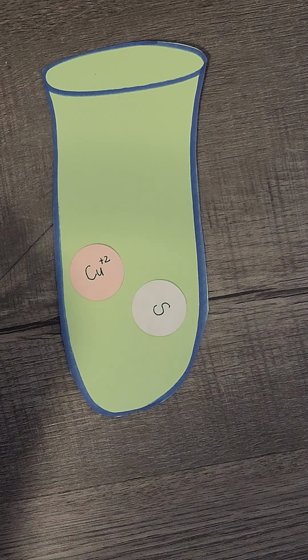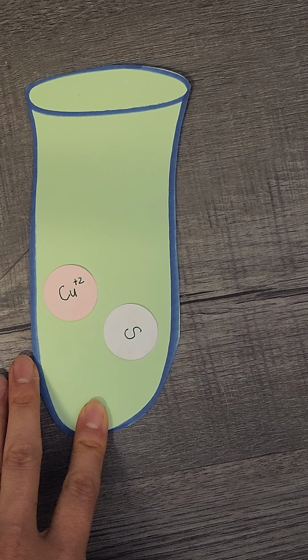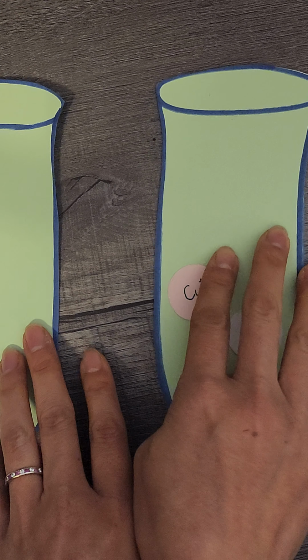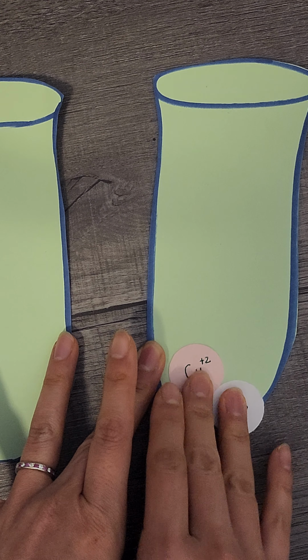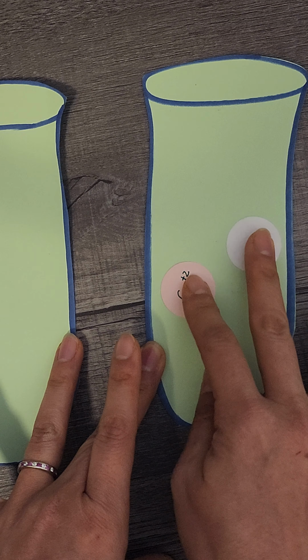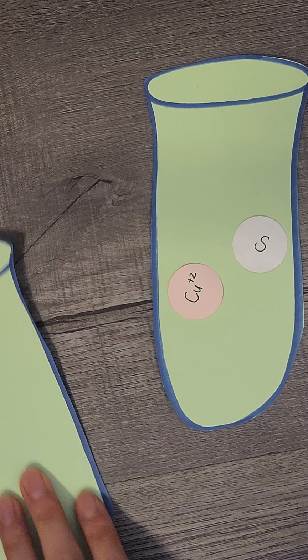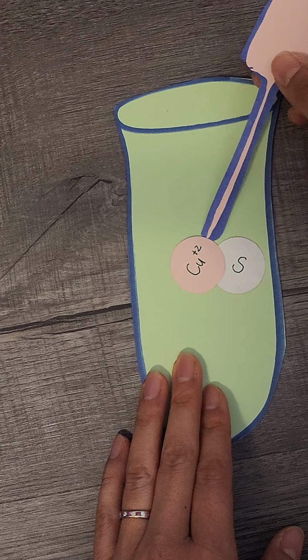Then take this out from the water bath. Then you're going to take a clean test tube with water, and you're going to spin it again, and some will float here. There will be some copper sulfide that are still together, but a lot of them will just kind of float around. And you're going to take the supernatant now. Let me take this out. You're going to take out the supernatant.